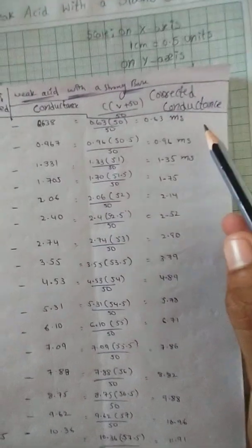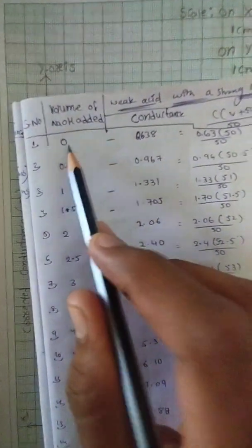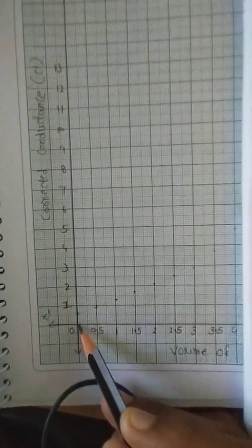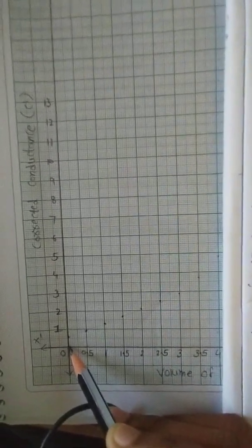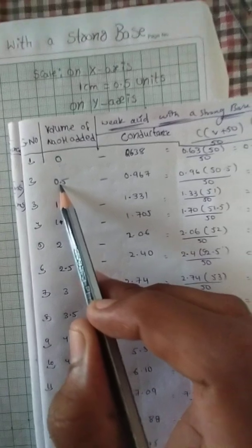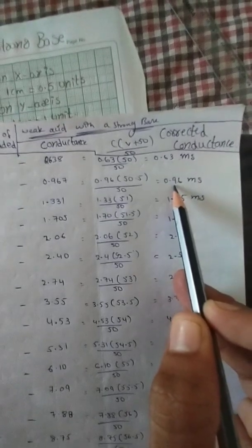We have to plot the corrected conductance values on the graph with respect to the volume of NaOH added. For 0 ml of sodium hydroxide, the corrected conductance is 0.63 mS — look at the point. Next, for 0.5 ml of sodium hydroxide, the obtained corrected conductance is 0.96 mS.